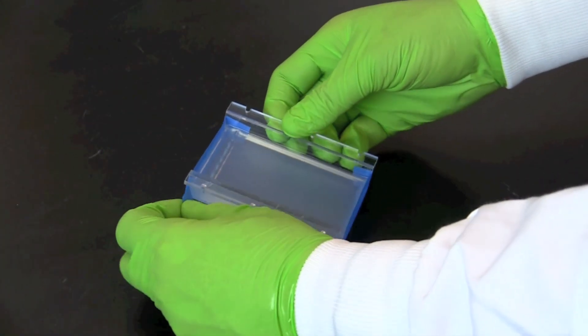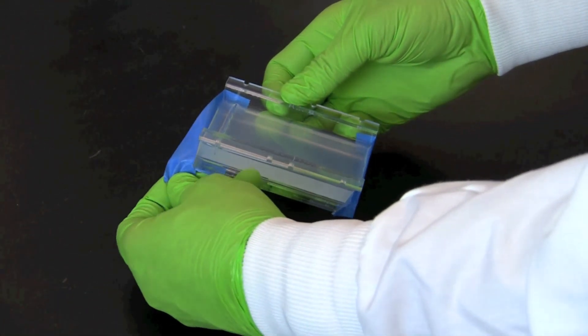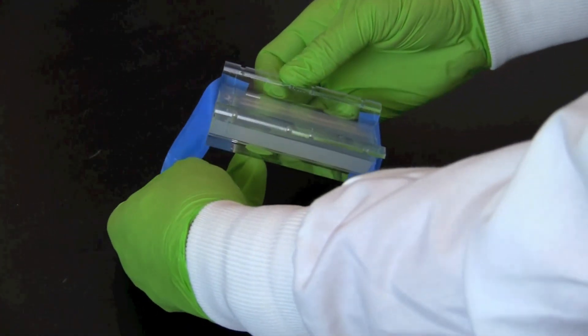If the gel is to be used immediately, remove the tape from both ends of the tray and continue with the activity.